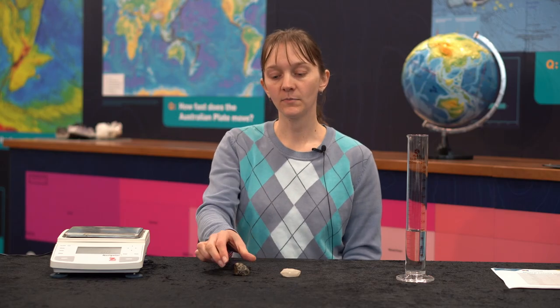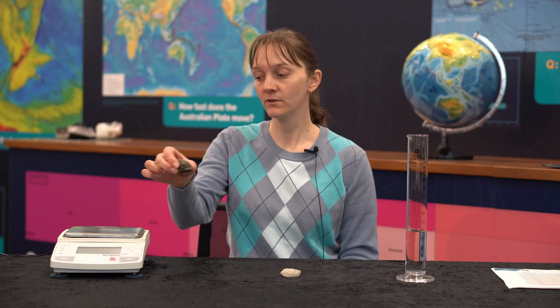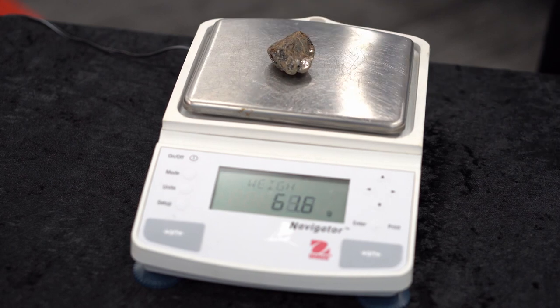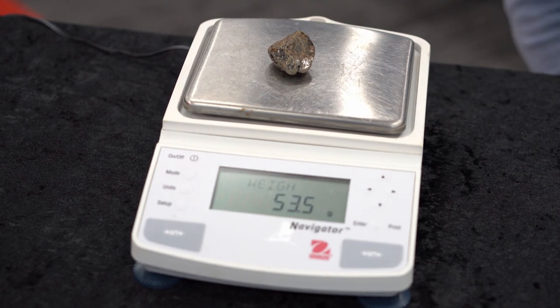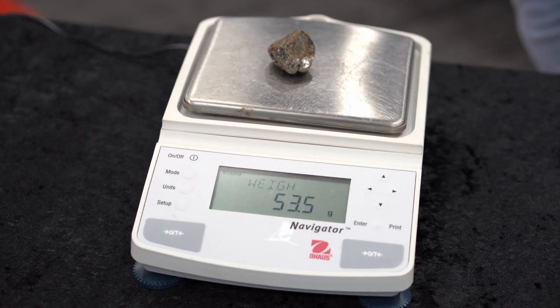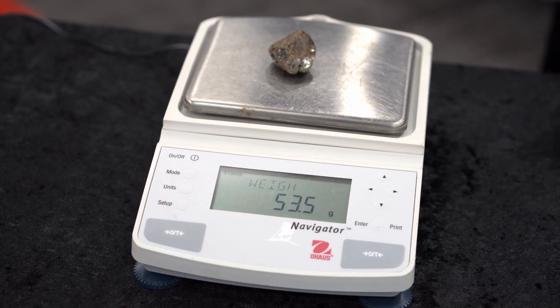Firstly, place your unknown mineral sample on the scales to find out its mass — in this case, 53.5 grams.